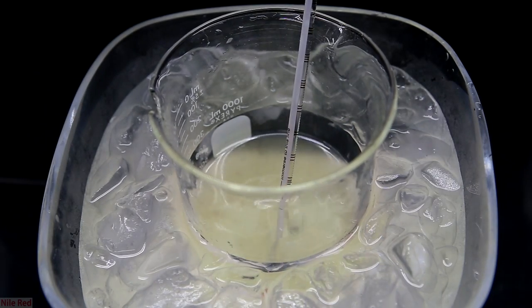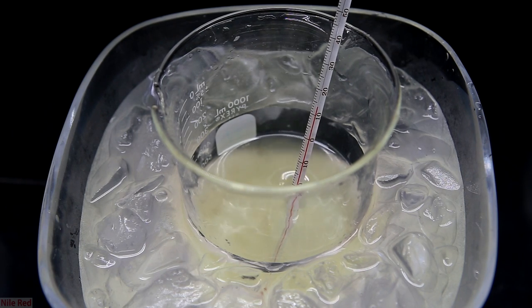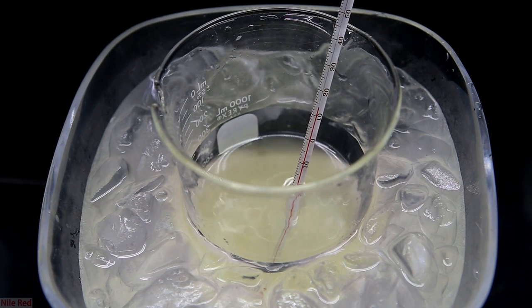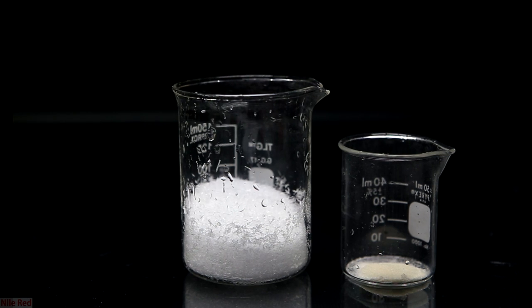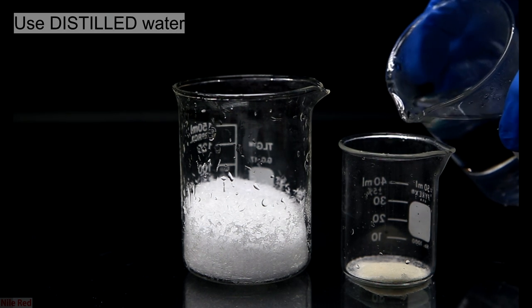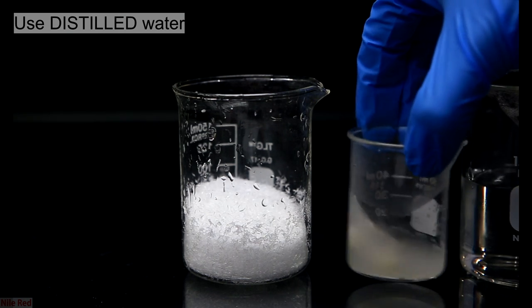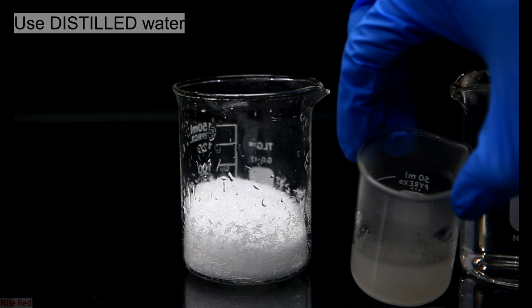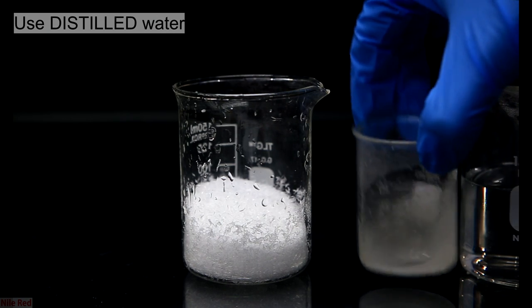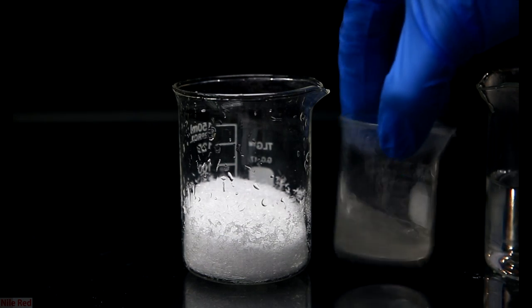After several minutes of adding small amounts of sodium hydroxide at a time, we're finally done, and I cool the solution back down to around 7 or 8°C. In the meantime, I prepare my gelatin-urea solution. I have my 22 grams of urea weighed out and my 0.75 grams of gelatin. About 15 milliliters of hot water was added to the gelatin to dissolve it. The gelatin solution might not fully clear up and it might be a little bit cloudy, but that's okay.